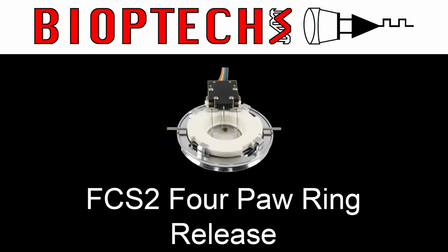In this video, we will demonstrate how to release an FCS2 chamber base if it will no longer rotate. There are 4 components to the FCS2 base assembly: the base, the 4-paw ring, the knurled ring, and the dovetail.